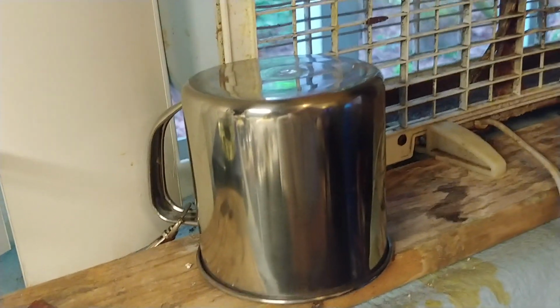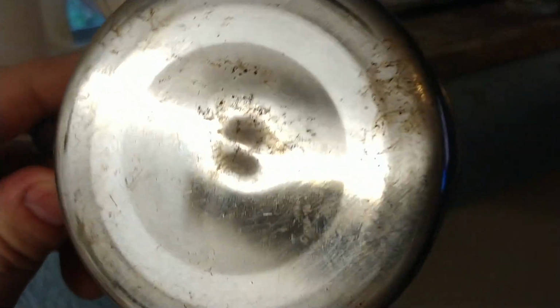Woo! My ears are ringing really bad from that. I did not expect it to be that loud. Anyhow, that's what can happen just on accident. Wow. That actually dented the stainless steel there. That was such a tiny amount.